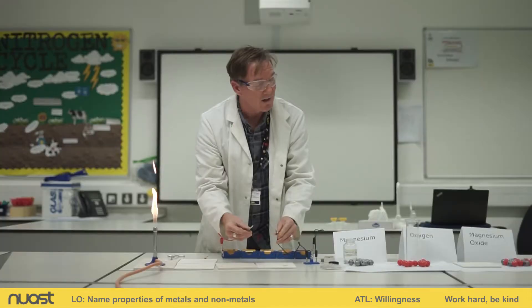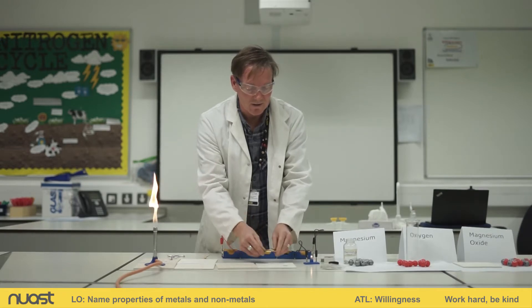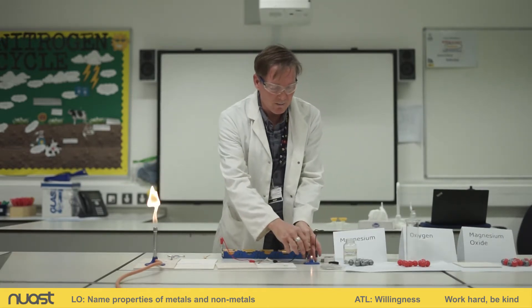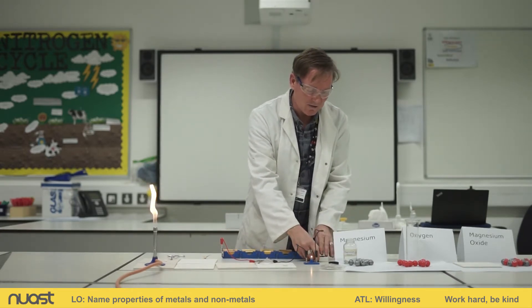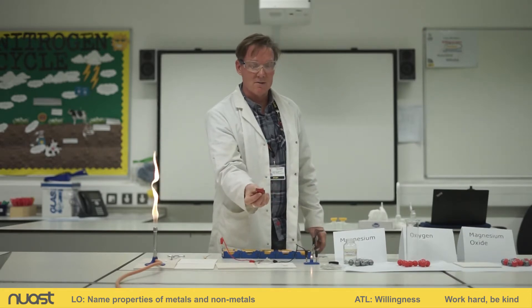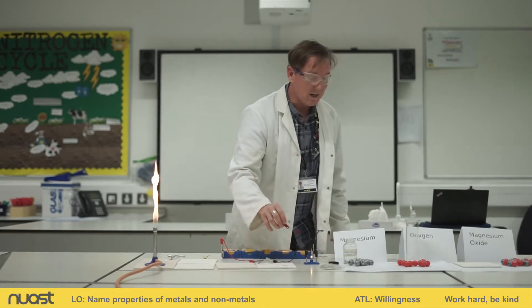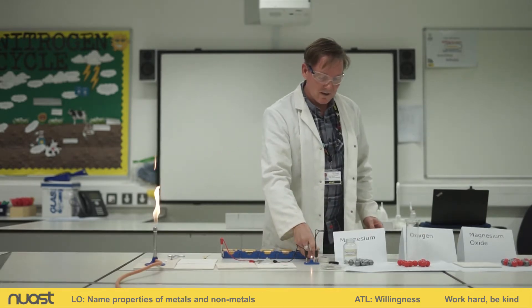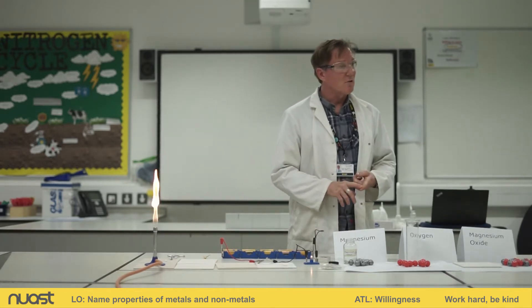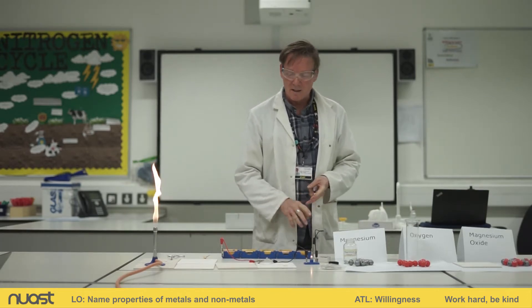I'll take away the magnesium so you can see it's not a trick. So the magnesium conducts electricity — that's one property you should know about magnesium. It is a metal. The next thing we're going to test for magnesium is whether it's magnetic. I have a magnet here, and you can see it's not magnetic, which is what you'd expect because magnesium isn't one of those magnetic metals. So magnesium is not magnetic, and it conducts electricity.